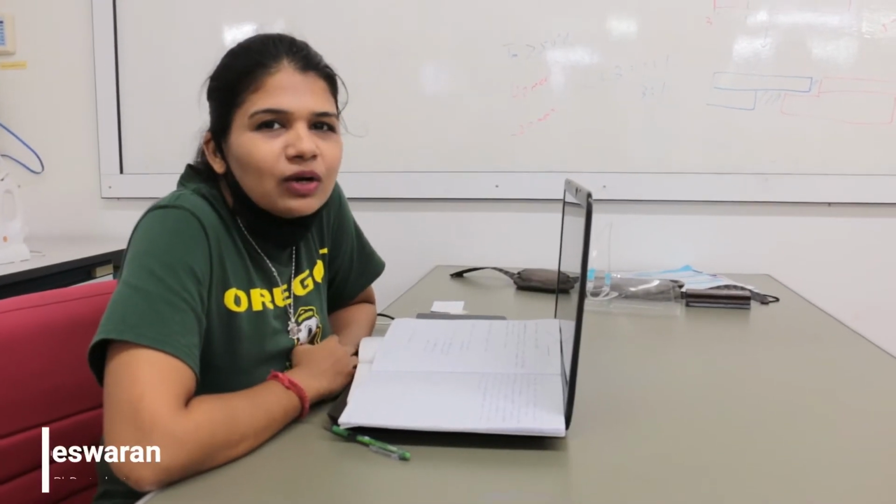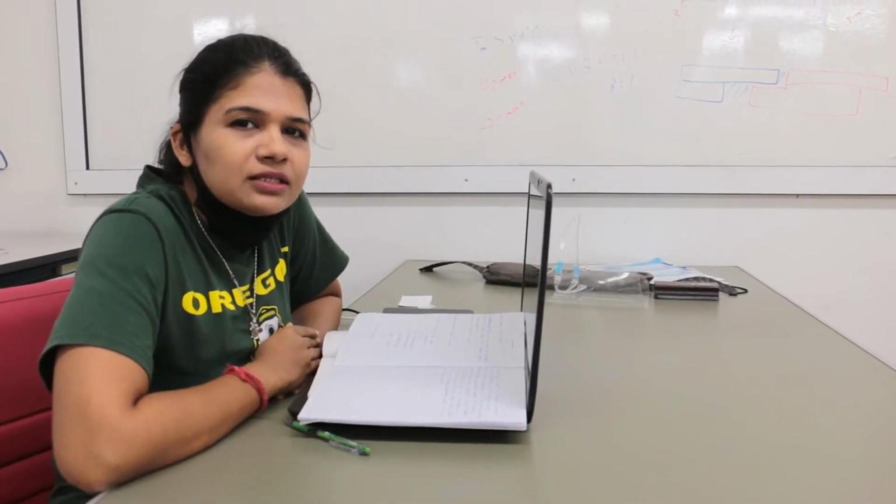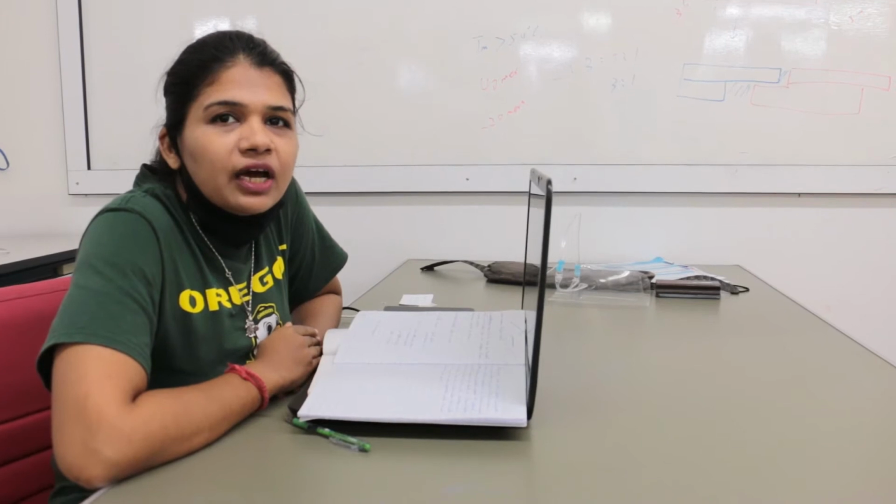Hello, my name is Karuna. Okay, I am from India. My PhD work is functional characterization of enzymes from plants. For that, I am using the wild type and mutant plants. I am using Arabidopsis as a model organism. For growing the plants, we have the plant tissue culture lab.